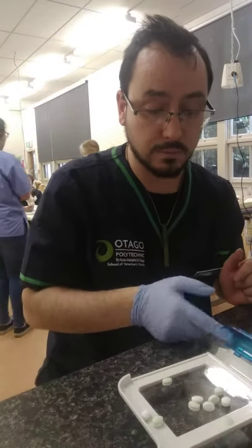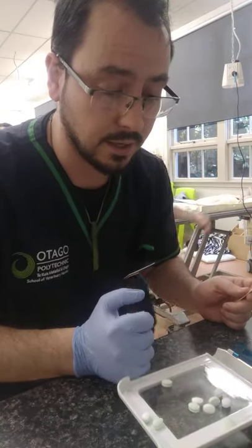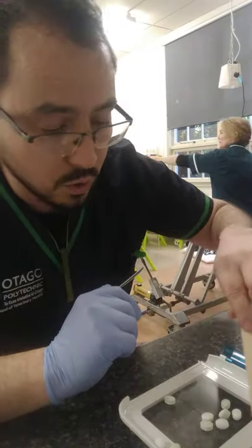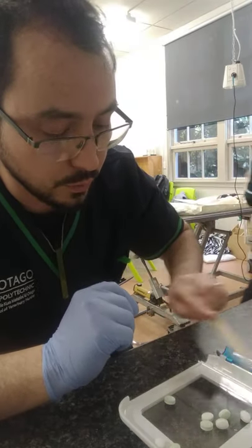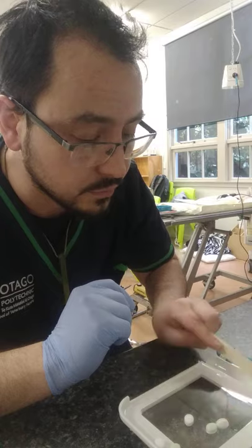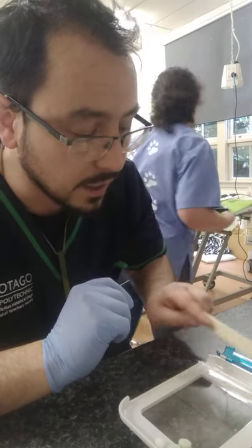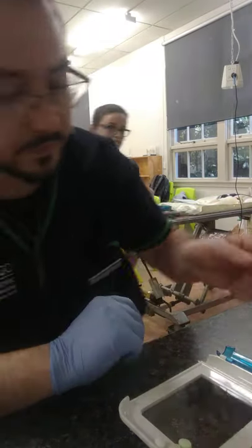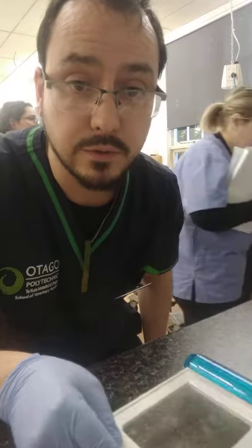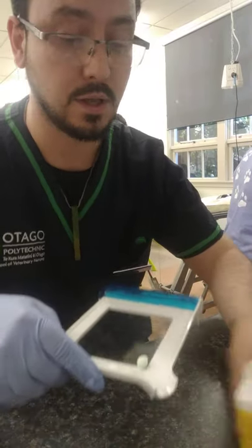Alright. I'm only touching back with my clean hand. And I will count out the tablets: one, two, three, four, five, six, seven, eight. Alright. Close. So I have a few left over — as you see here, I will put those back into the container.